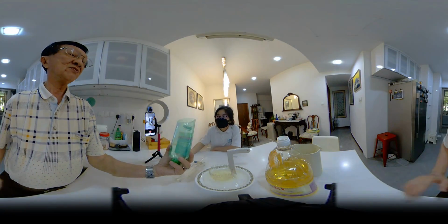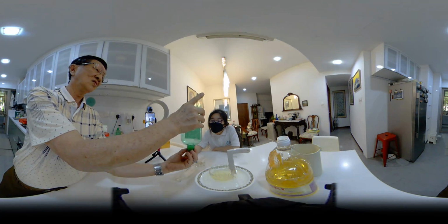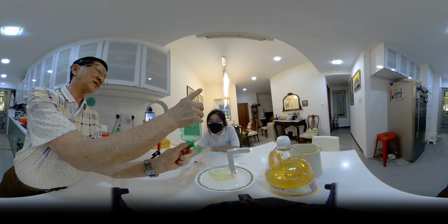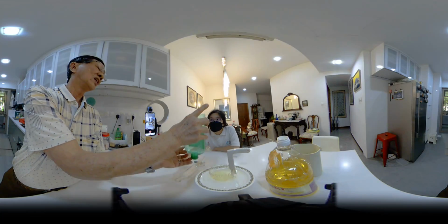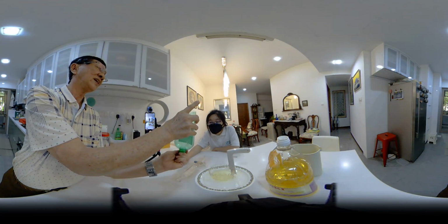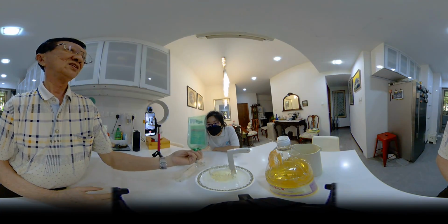And with this cheap separating funnel, again, we can put the oil in and the water and let the water out first by letting go here. And when about all the water is going to be drained away, you close this. Again, you waste a little bit, and then the rest of the oil can then be drained into another container. And this doesn't cost a cent. This is very, very cheap.